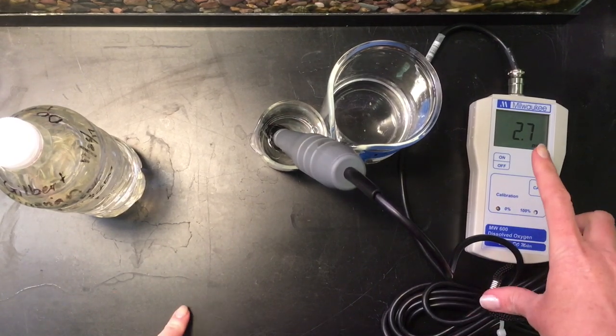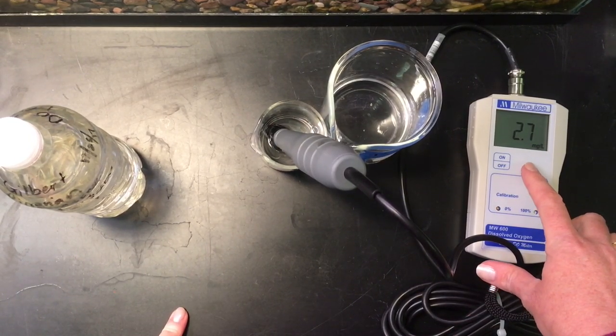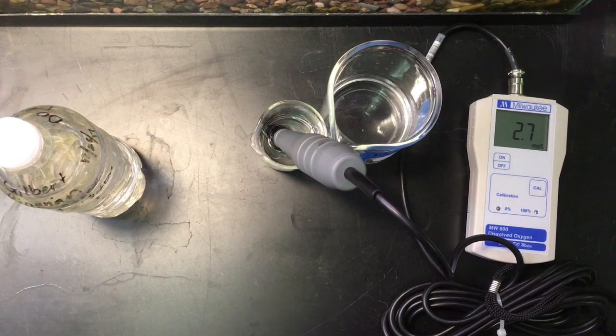So after one minute our dissolved oxygen has stabilized at 2.7 from this pond.